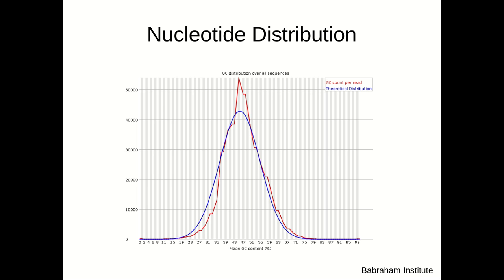And so one thing you need to look out for is nucleotide distribution. You want to see that your GC content in your reads basically fits your GC content in your genome. In a perfect scenario, we expect the GC content to follow a normal distribution with a mean equal to the mean GC content in your entire genome. Here we have a case where, in red, the actual experimental distribution in our reads doesn't match up with that theoretical distribution. That indicates that something went wrong here, that somehow we were favoring certain regions in the genome over others perhaps. So it's just something to watch out for there.